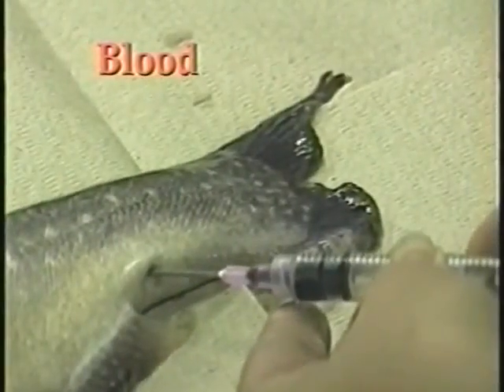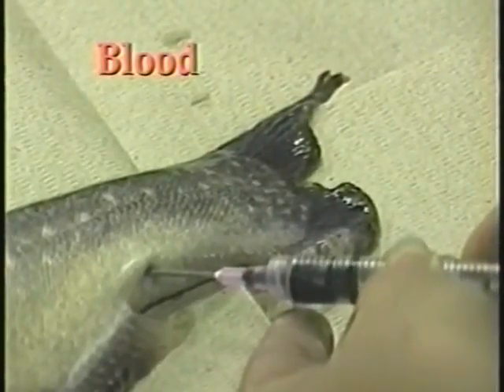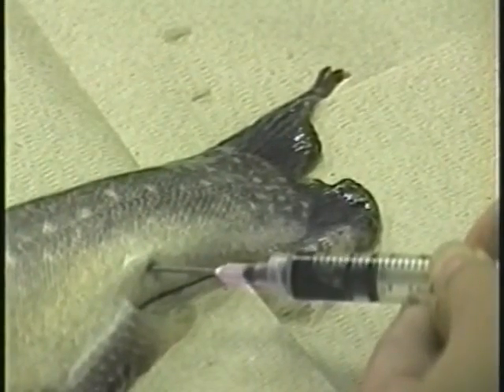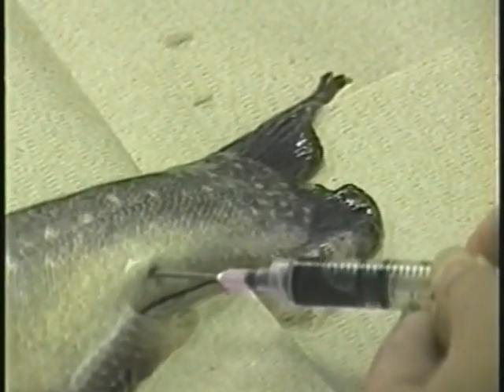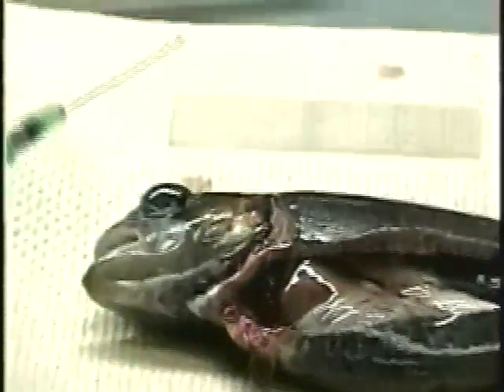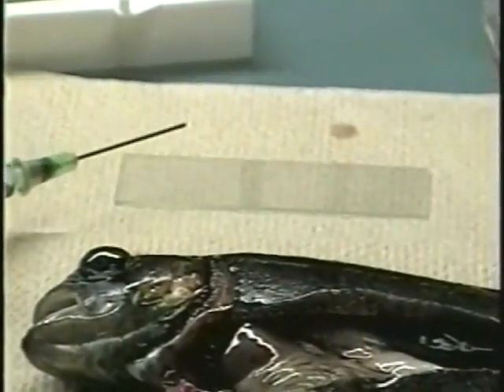To detect blood parasites, collect samples immediately after the fish is killed and before the blood clots. Blood should be collected as described in the first chapter using a heparinized container, or the fish may be opened and a few drops of blood removed from the heart.